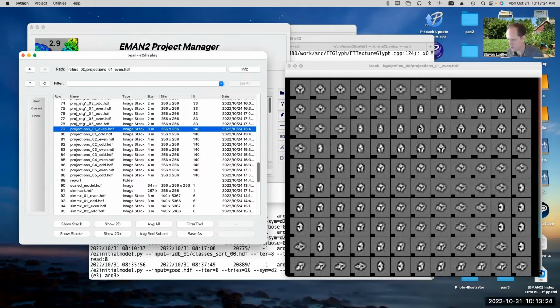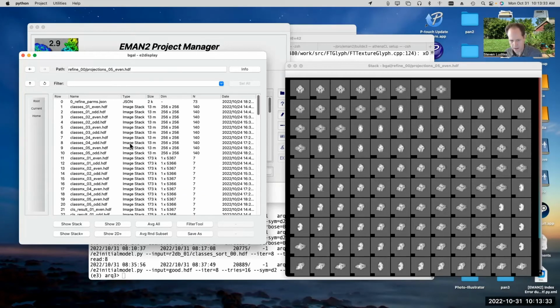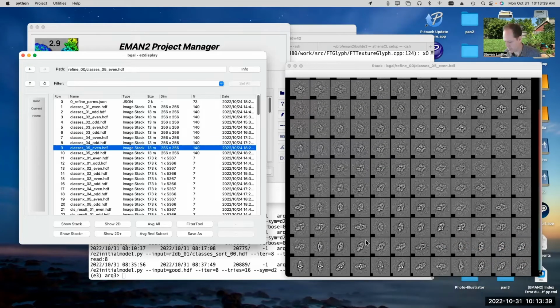But in general, you should see good agreement between the class averages and the projections, particularly once we get to the last iteration. So here are the projections from the last iteration, and here are the class averages from the last iteration. You can see even at high resolution, they agree pretty nicely now.